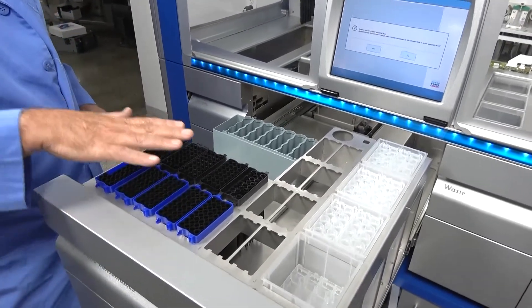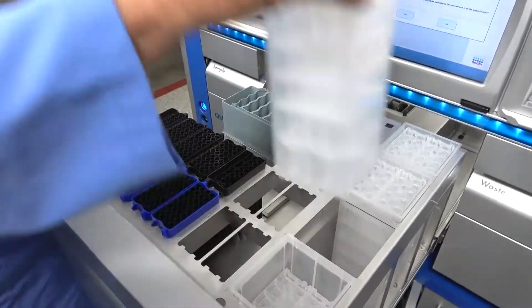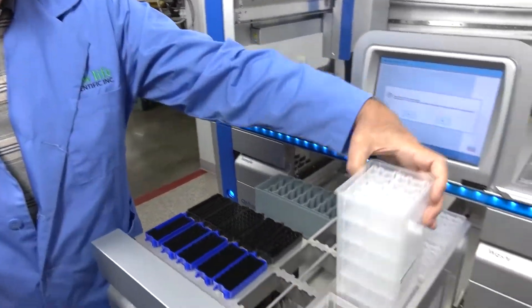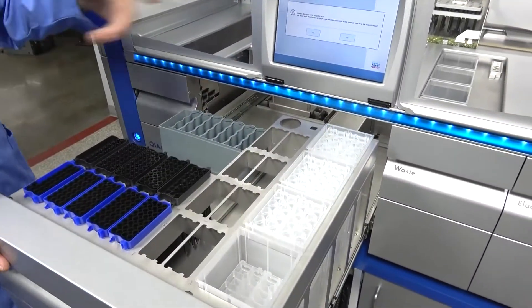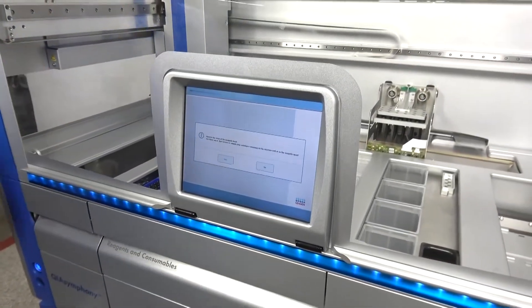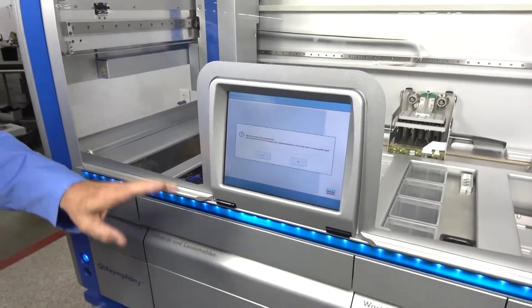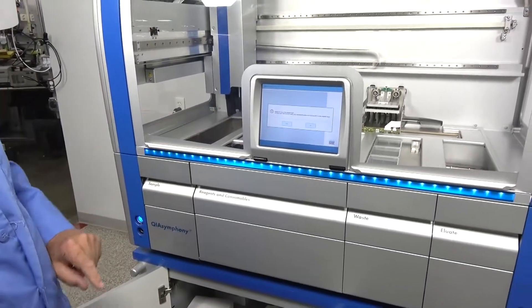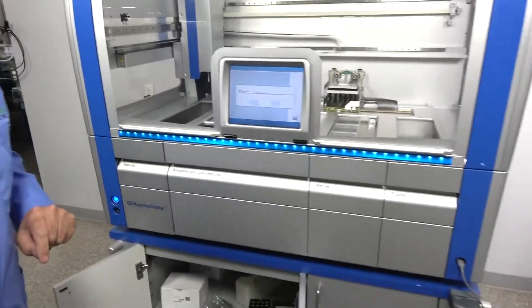These are the tips that you're going to need. When you need to change your consumables, that's how easy it is. You open the pack. There's a lid that goes on. You drop them in. You put it in. The unit will ask you, hey, that drawer opened. Did you change anything? Do you want me to scan it? I hear it's asking for something else, but we're going to go on and show you just a couple other things real quick.